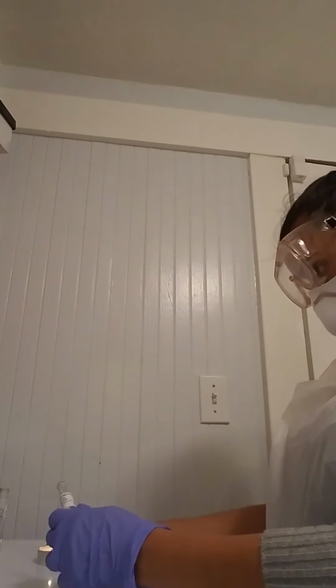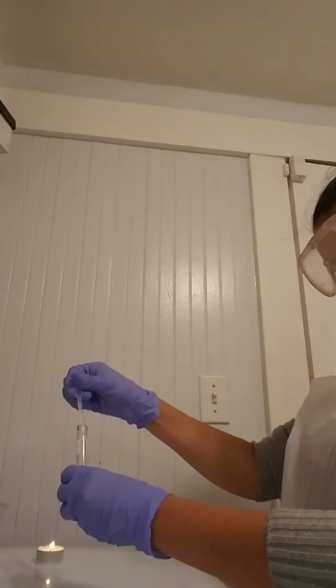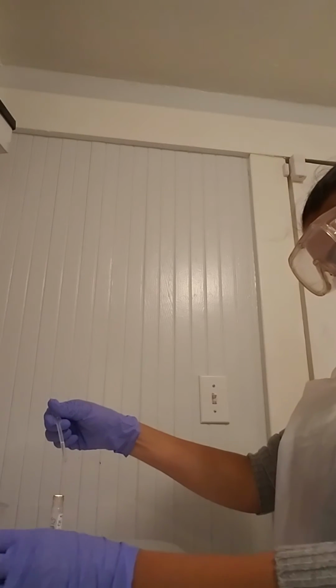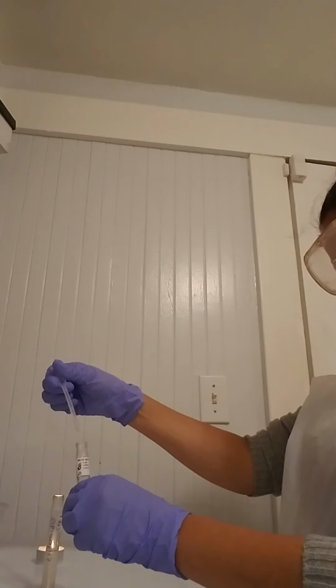I'm sterilizing, trying to work as fast as I can, and again I will withdraw and add 4 drops. 1, 2, 3, 4.